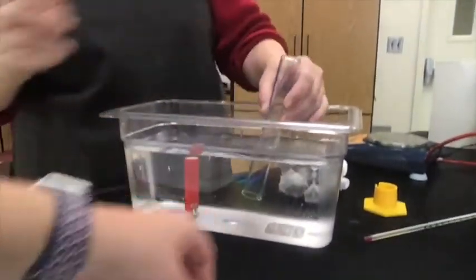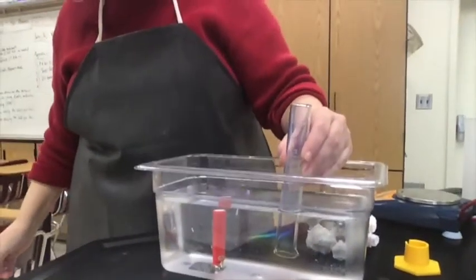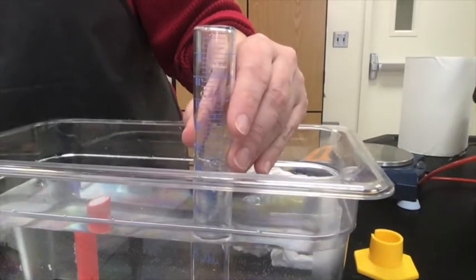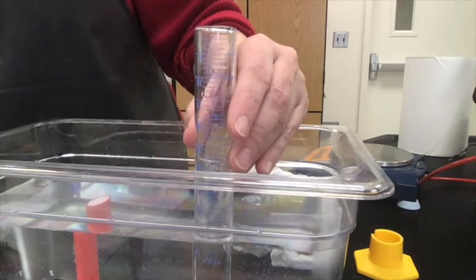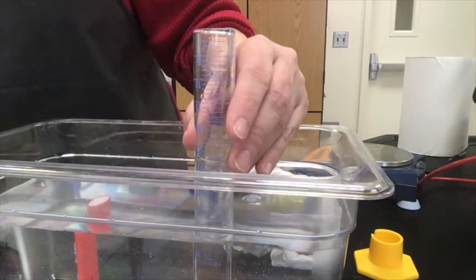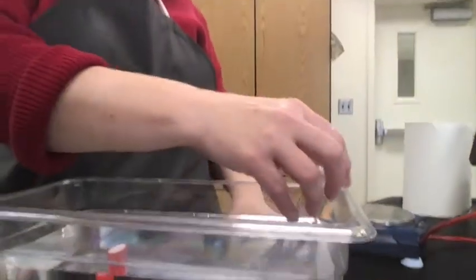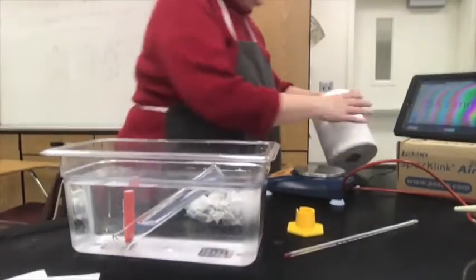So coming back over here to Miss Thomas, who's got her sample. I'll try to bring it on over. See if we can get this here. So we're looking again down at eye level, 45, 46, 47. I thought I got it past 47 this time. I would say it's about 47.9, almost 48. Maybe so, go 48.0. Yeah, about 48.0 milliliters will work for your volume.